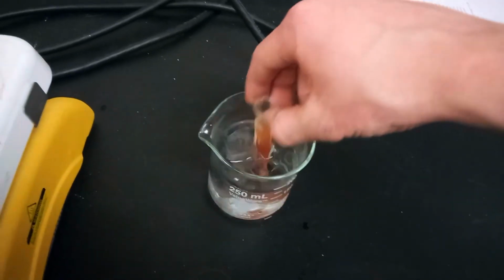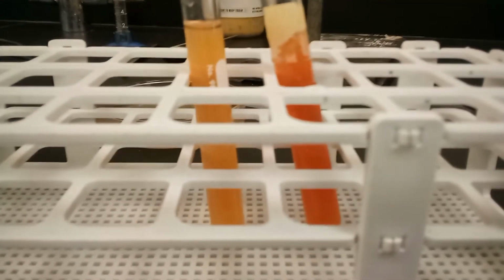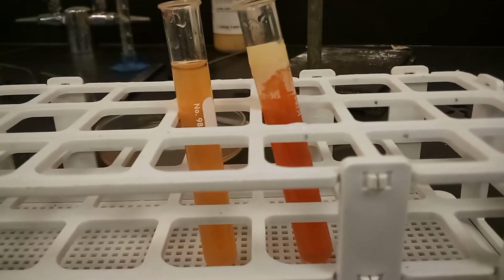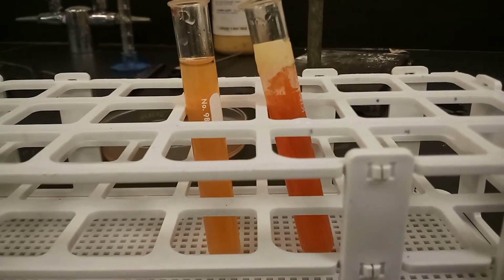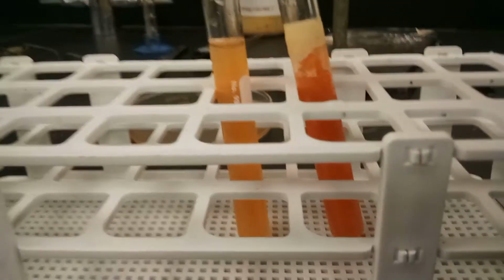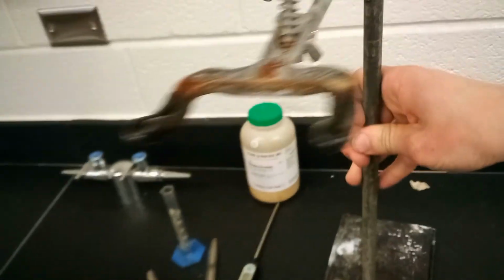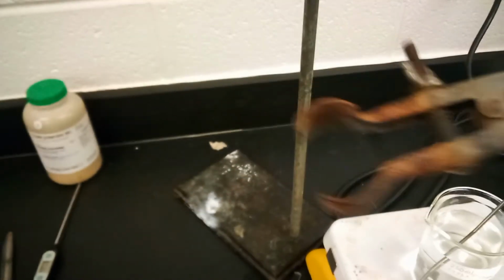So here we go. 5 minutes later, we can take it out of the ice bath and compare it to test tube A. You'll see that the one on the right, test tube B, is way darker. That tells us that there are more products present now after taking away the heat. There are more products present. That should tell you one side of whether or not this is endothermic or exothermic, depending on which side the heat is on in the reaction, which is kind of the point of this introductory activity, to expose you to how temperature relates.